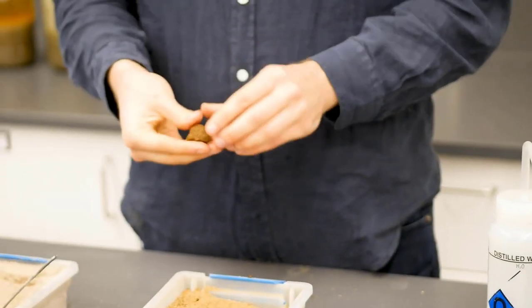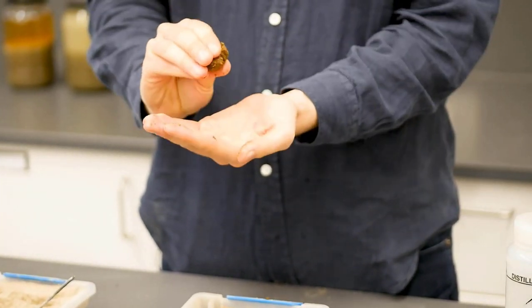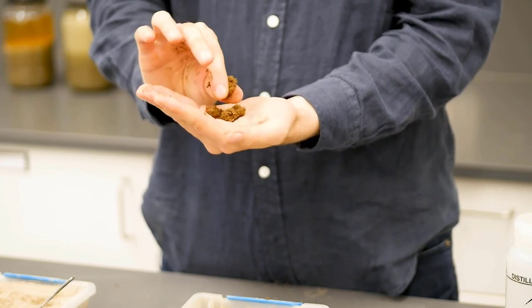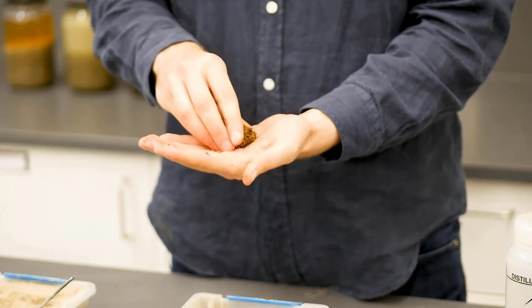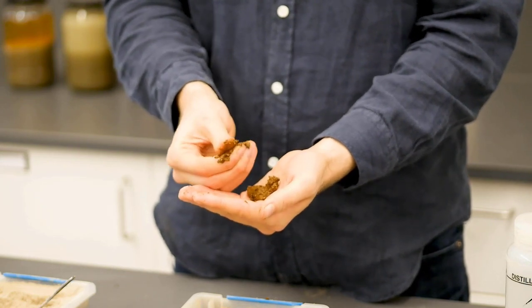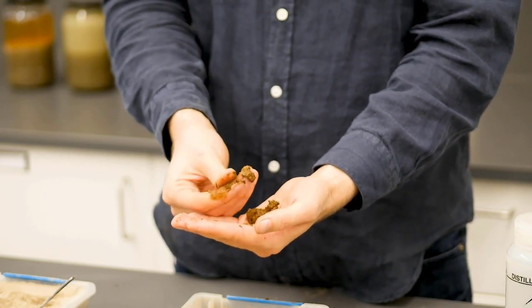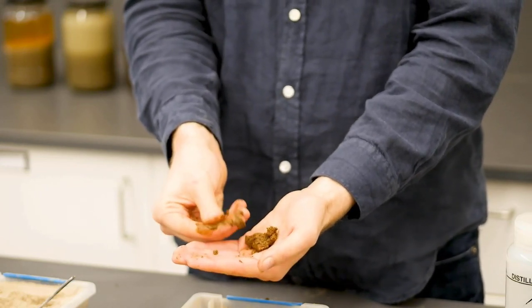So some additional considerations when you're determining your soil texture are the stickiness test. You can compress your soil sample between your fingers, and when you pull it apart, see how much it sticks to your fingers and how much it stretches. So the more stretchy and sticky your soil is, the more montmorillonite clay there is present. There's also the soapiness test. You can just rub the sample between your fingers, and the more silt there is present in the soil, the more soapy or slick the sample will feel, as opposed to clay, which will be sticky, and sand, which will be grainy.